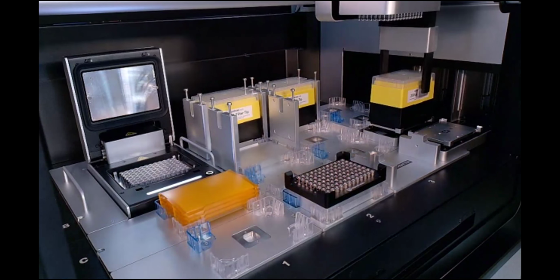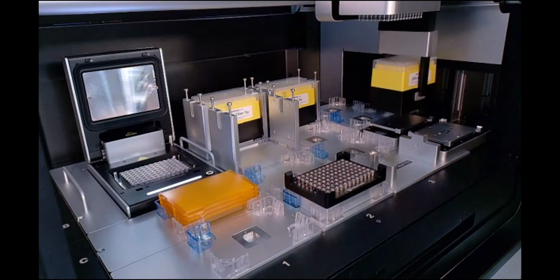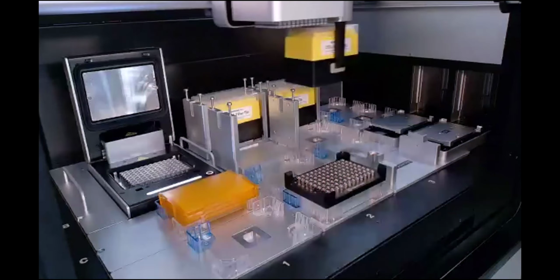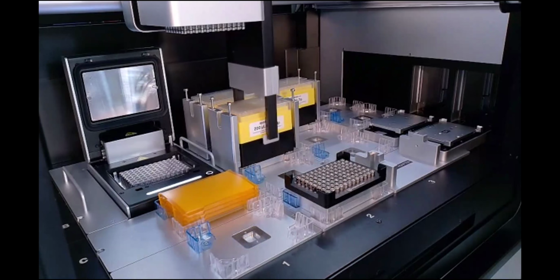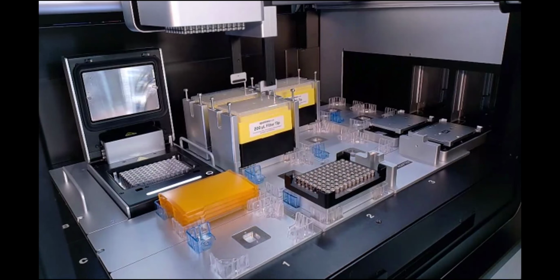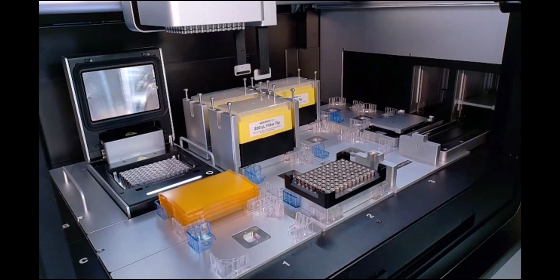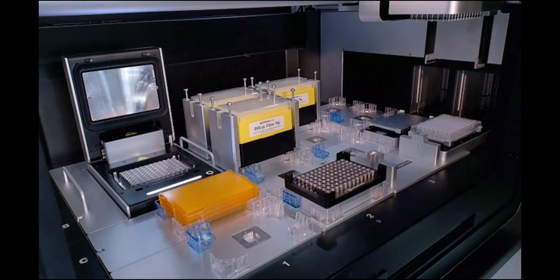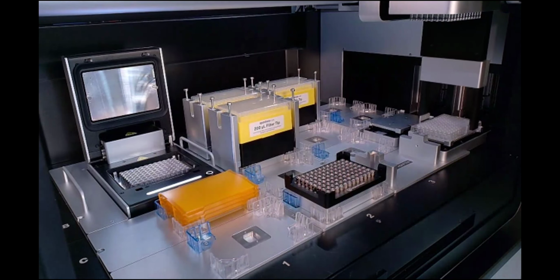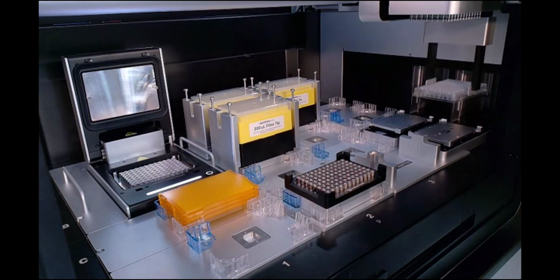Okay, perfect. Now the protocol that's running behind me now is not Matt's specific protocol as he was going through and running it, but instead just showing off functionality of the equipment that we have available. So here you'll see the stackers dispensing 200 microliter tip racks. All of these currently have their lids on top of them. And so in protocol, you would just have to specify for these lids to be removed. You either have the ability to put those onto an empty tip rack or to throw them out through the trash chute. And then you can do the same thing with the tip racks themselves.